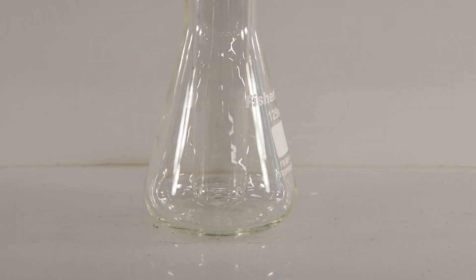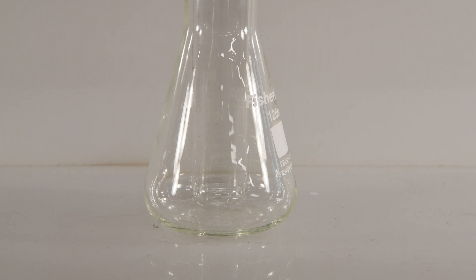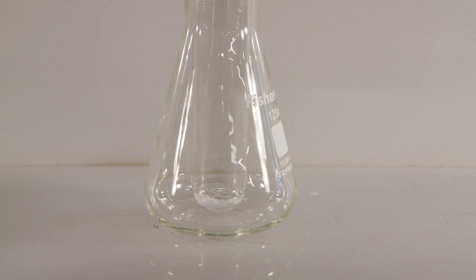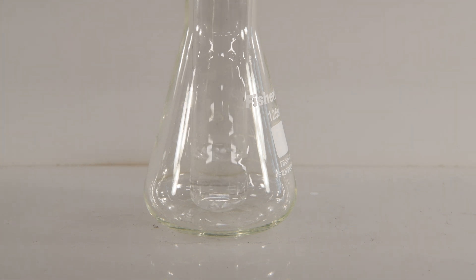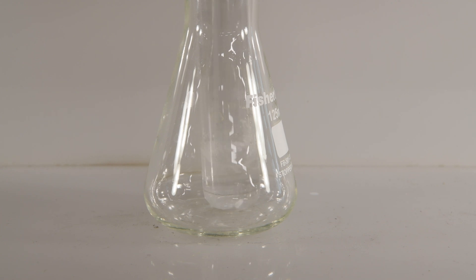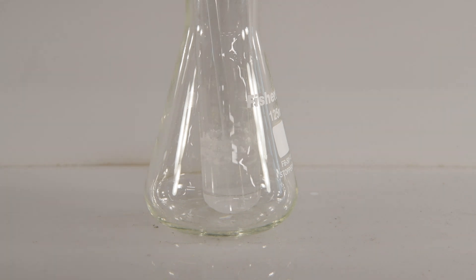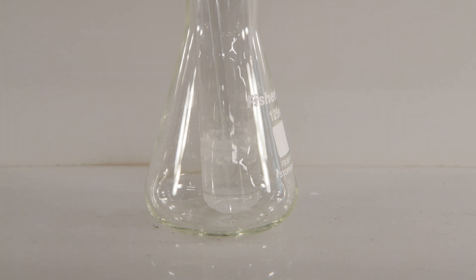Next, let's try our salicylic acid with deionized water. We'll put a little sample in the test tube and add some water, then stir it around. I can see lots of little chunks of salicylic acid — it's all in there. Salicylic acid does not seem to dissolve in water; it's just floating on the surface.